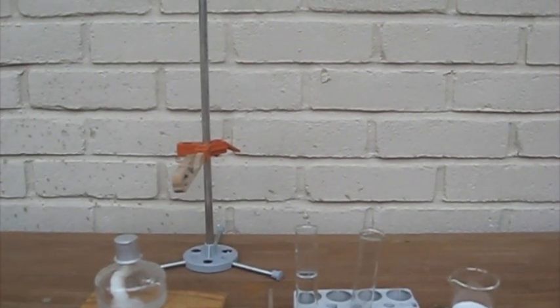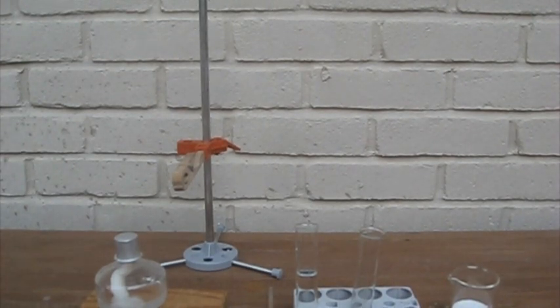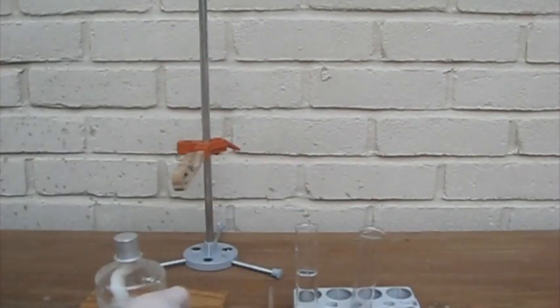Today I will show you how to synthesize hydrochloric acid. For this you need salt and sodium hydrogen sulfate, which is sold as pool pH decreaser.